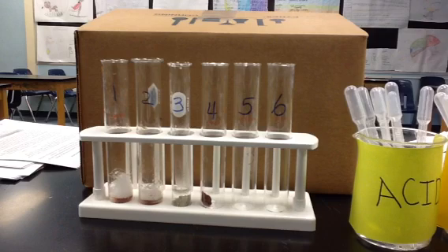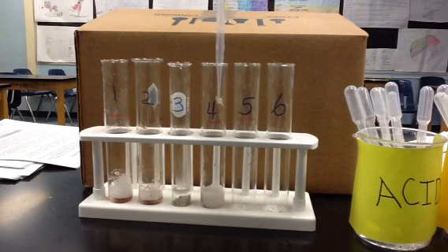In test tube number 4, we're going to look at a neutral pH. A neutral pH is a pH of 7. And the most common substance that has a pH of 7 is water. So we're going to add a little water with the liver. And now that pH is 7. Now we need to add the substrate, and the substrate is the hydrogen peroxide, H2O2, to determine if there's any reactivity.